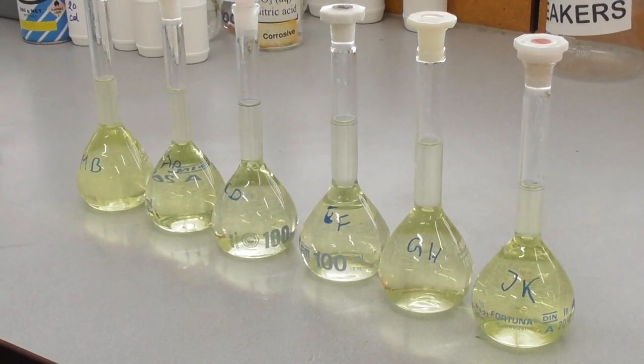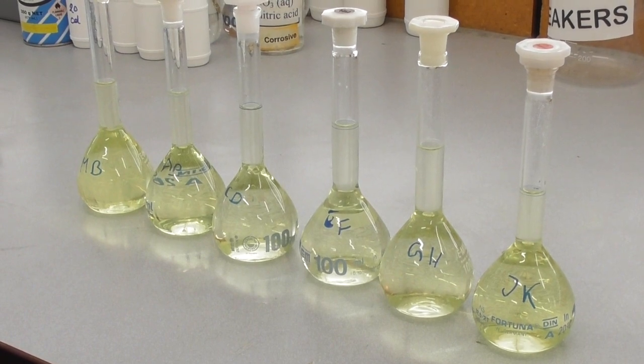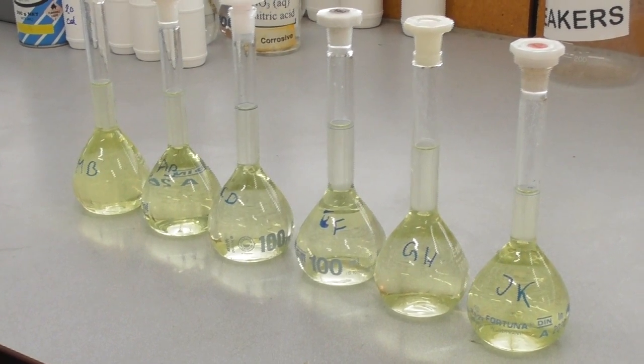Once all the solutions are ready, the flasks will be lined up next to the instrument. Before we measure the absorbances, we need to prepare standards.